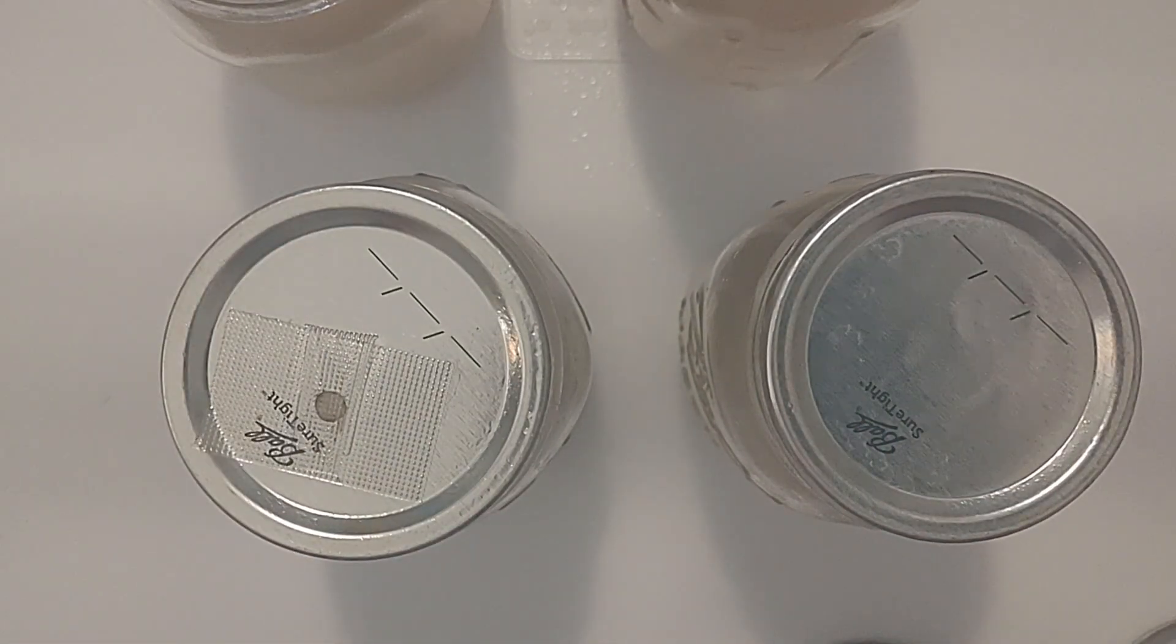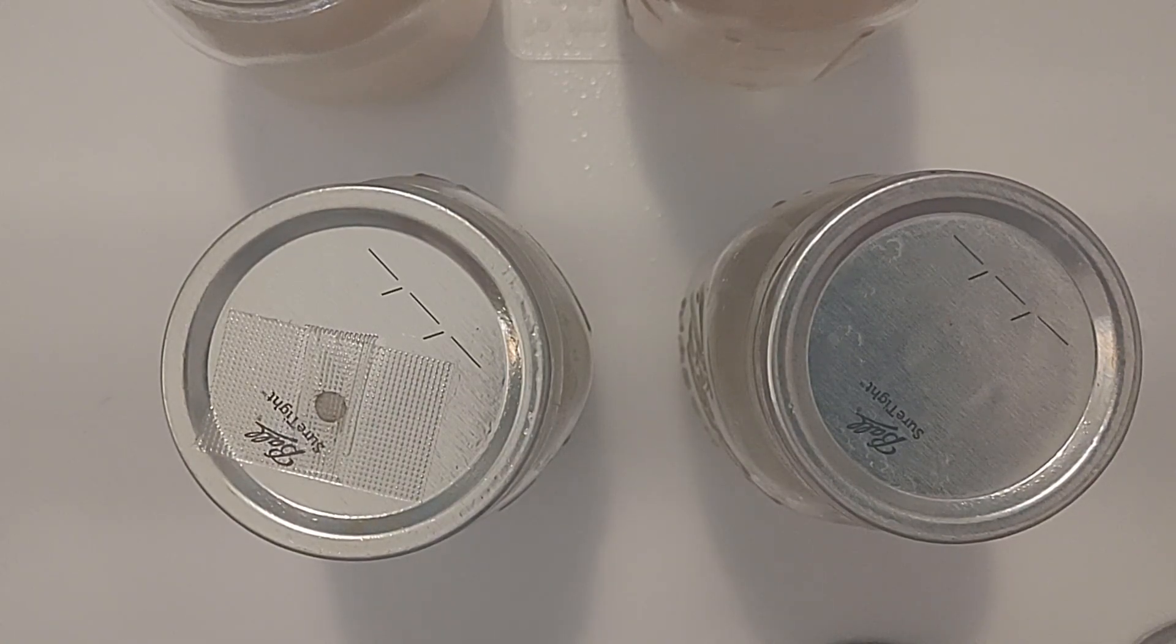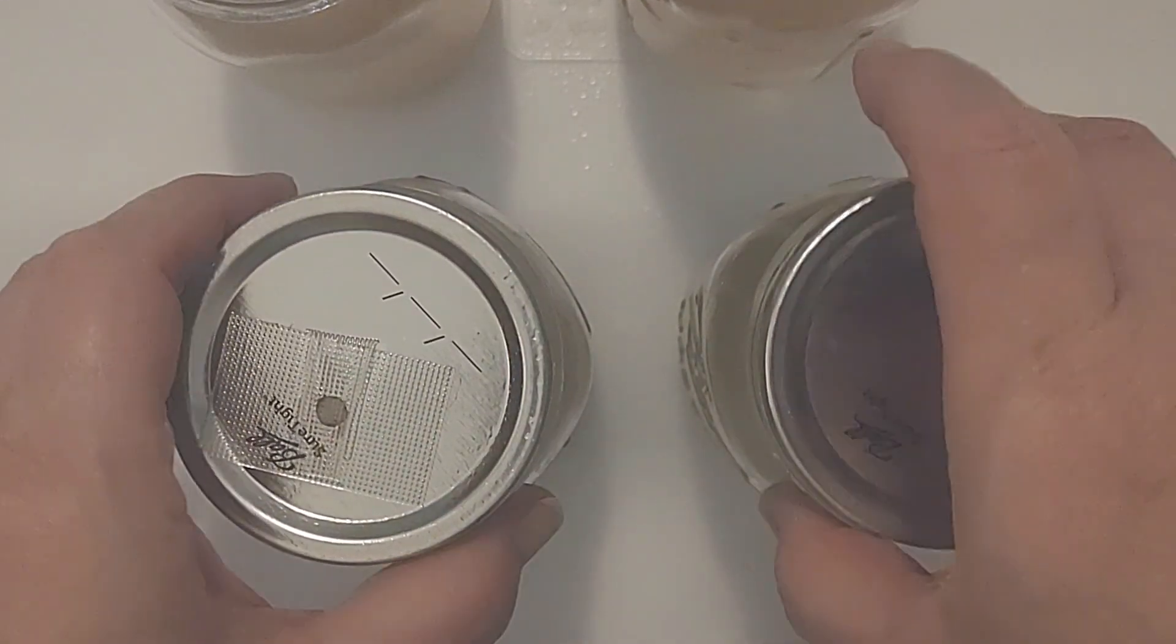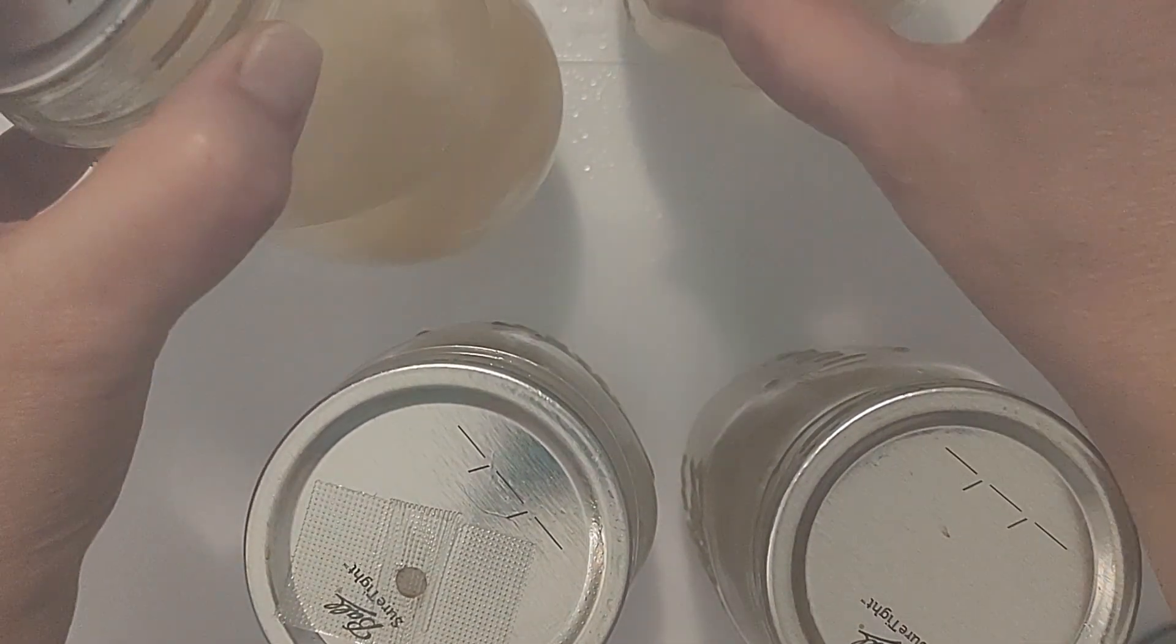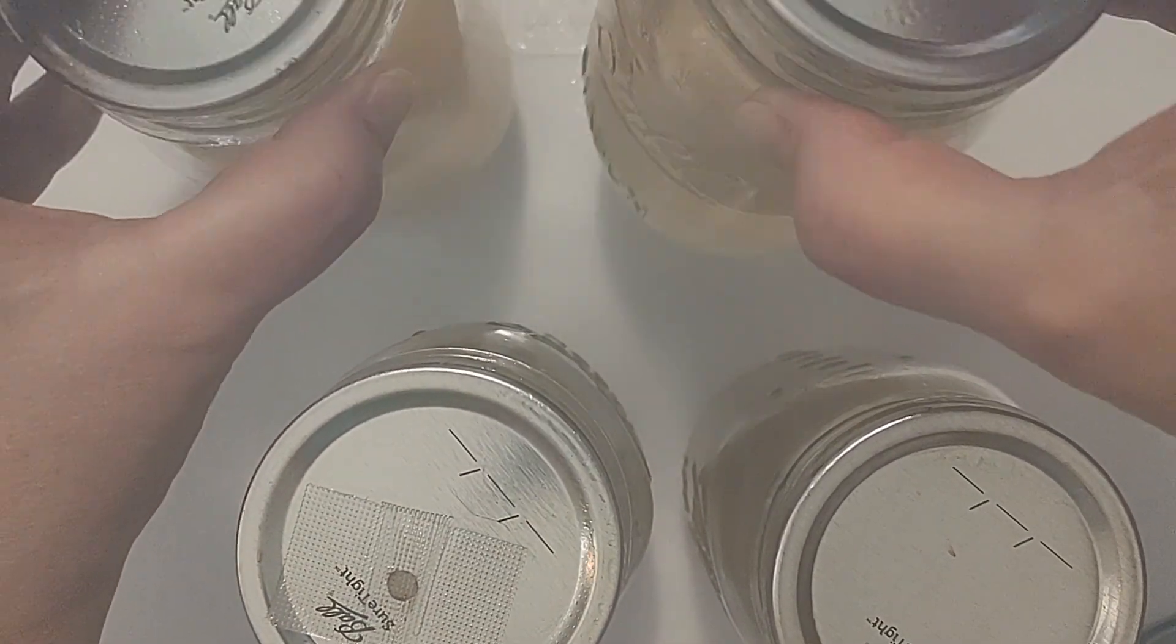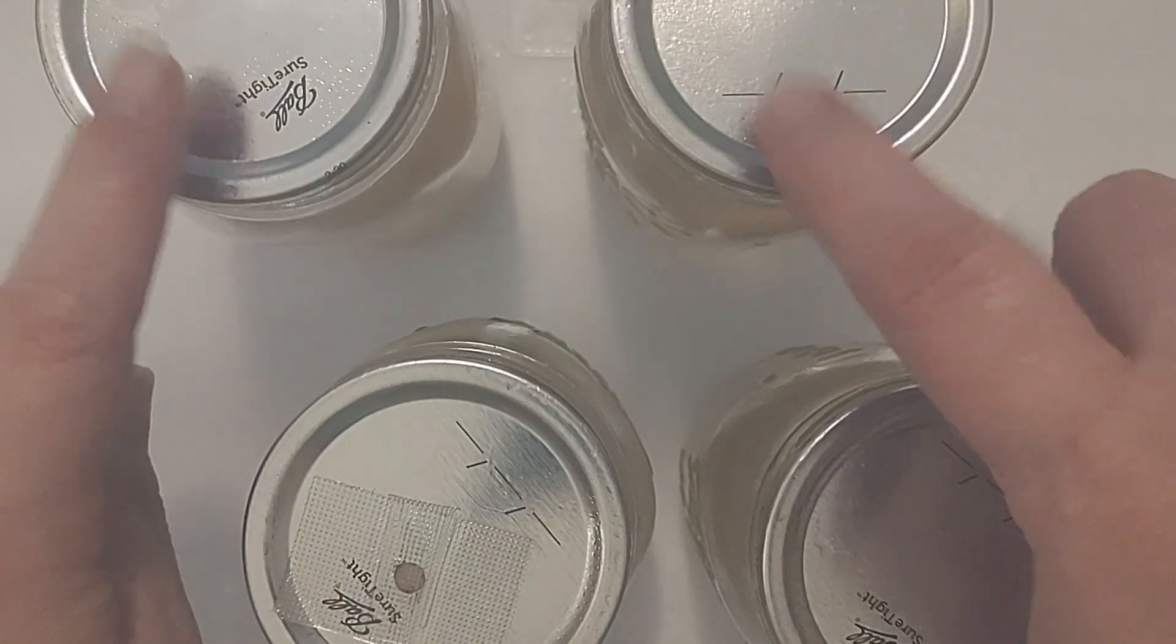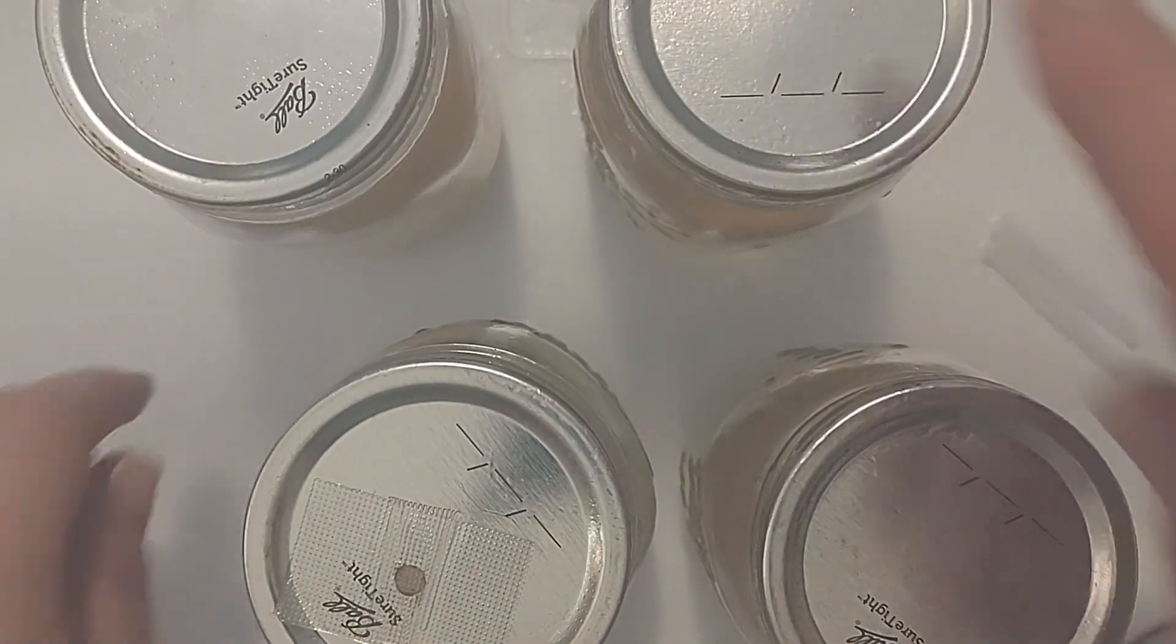So I just wanted to show you this process and show you how fast it is that you can expand your liquid culture. I mean we just went from having this one to now we have another one. So if you're ever concerned that you're going to run out of your liquid cultures, just grab a syringe and move it to another one.